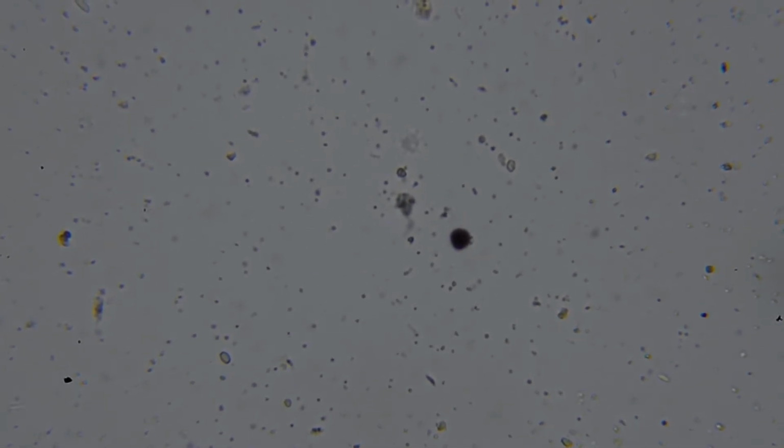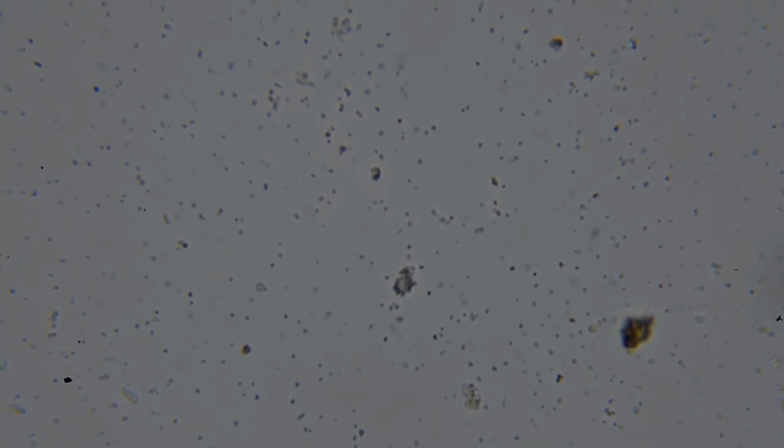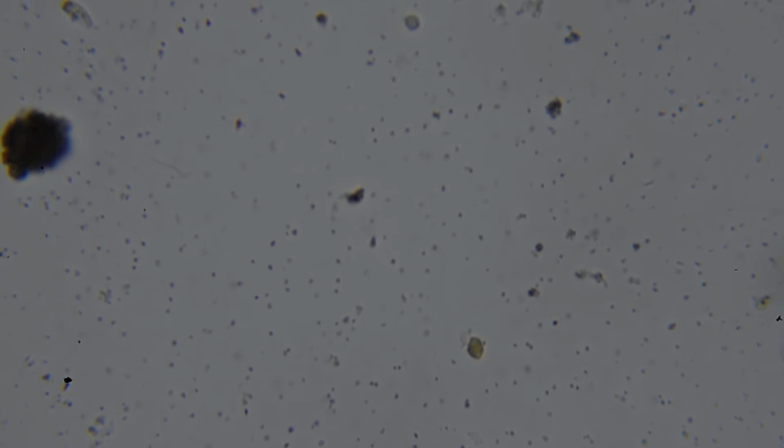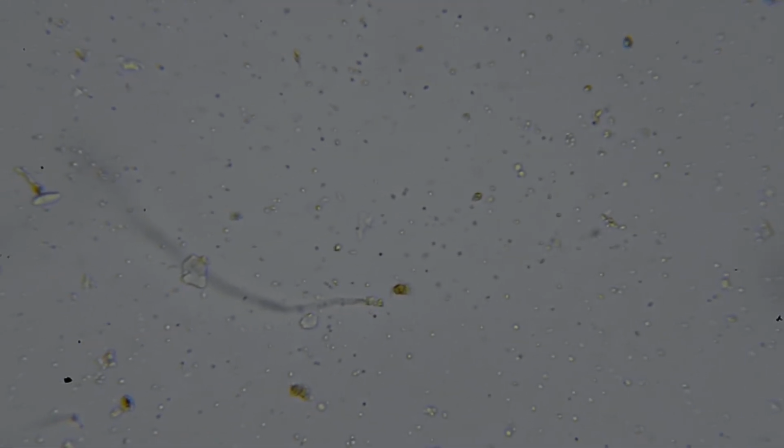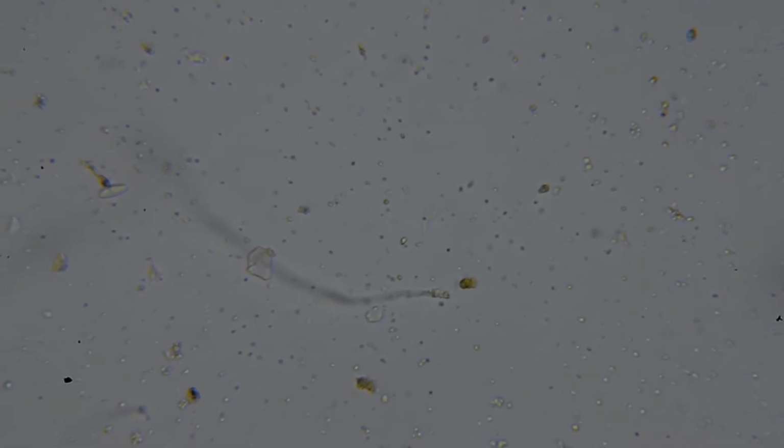And the interesting thing about this, I think I catch one in a moment, is there's a spirochete goes zooming across the screen. And this is because this sample's actually been given to me and held in an airtight jar. So this compost, basically, which is what it is, has gone anaerobic, which means that there's this turnover from the obligate aerobes to the obligate anaerobes.